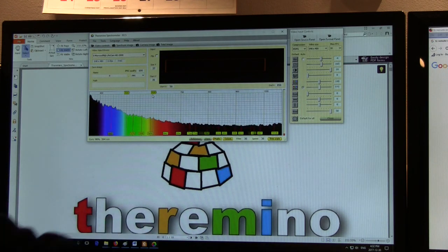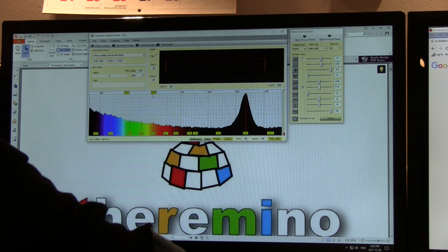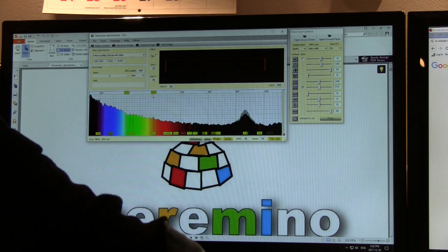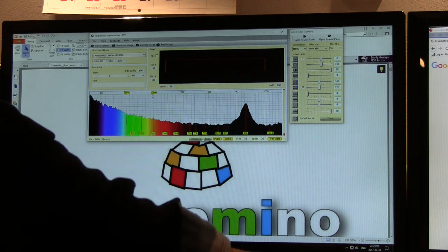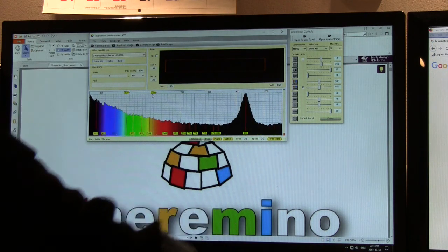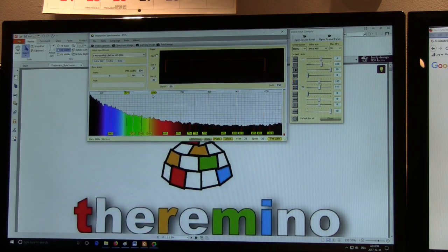If I pick up a different remote, you can see here we're seeing the same thing. So these are just television remotes that I picked up from the TV and the VCR. So yeah, this is going to be great for visualizing all that stuff that you can't see with your naked eye. Maybe some 785 nanometer lasers and that type of thing. So I think it has a lot of versatility in terms of use, so I'm going to be experimenting with that more in the future.